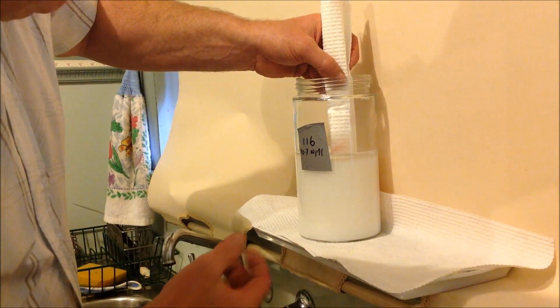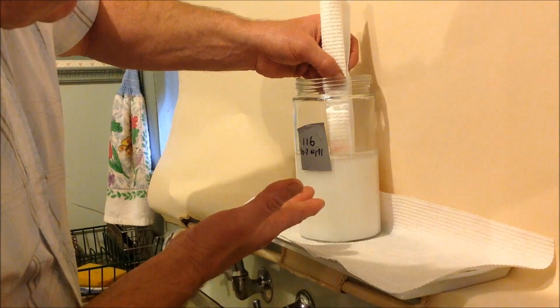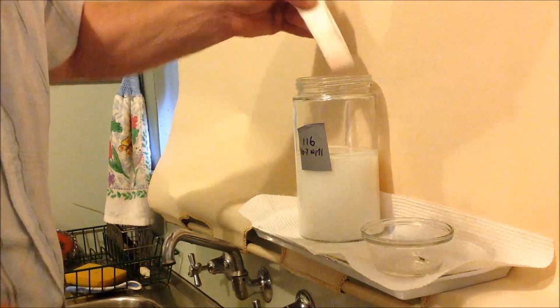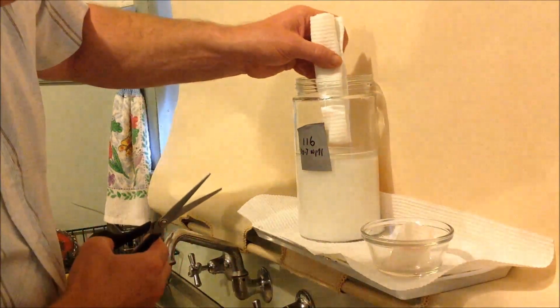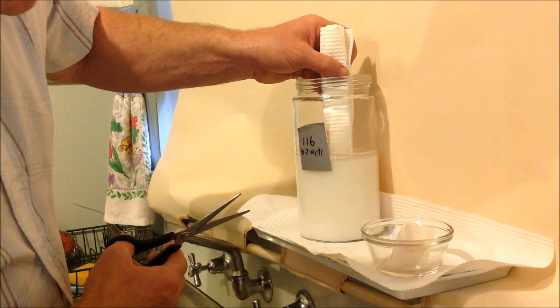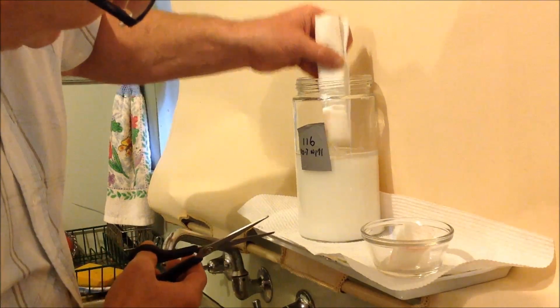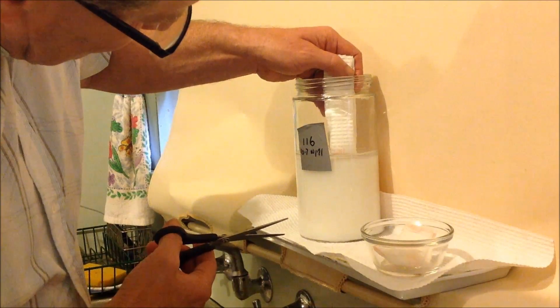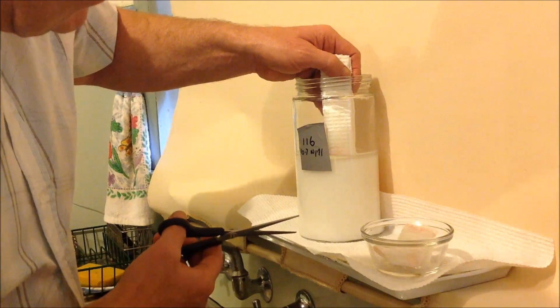So it's already up like 30 millimeters, 40, 50 millimeters, 60. Cut it off like that, and you'll be able to draw a lot more of that moisture off without sucking up the Ormus. I'll just do a little bit more. I'll just do this whole towel actually.